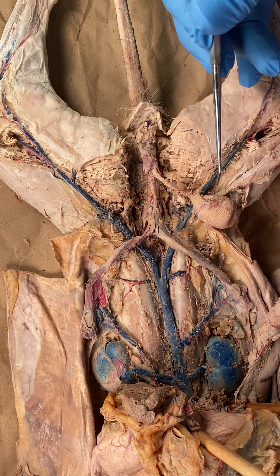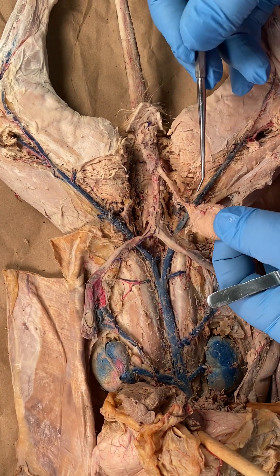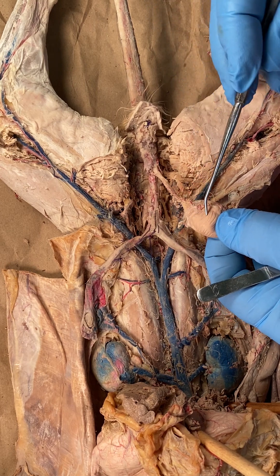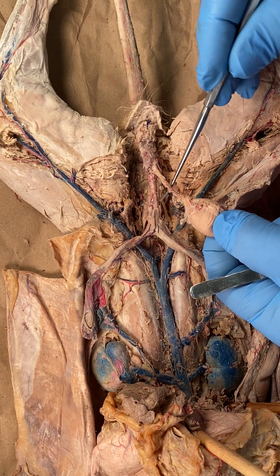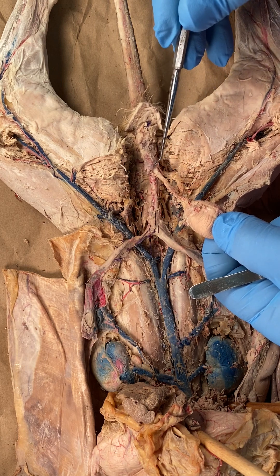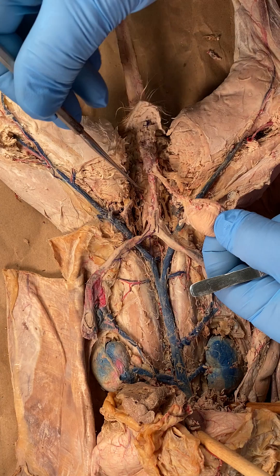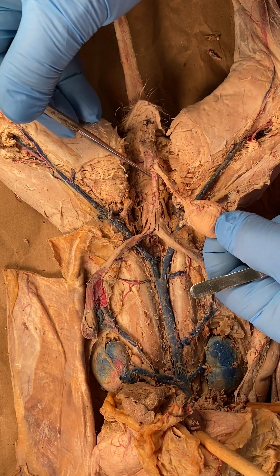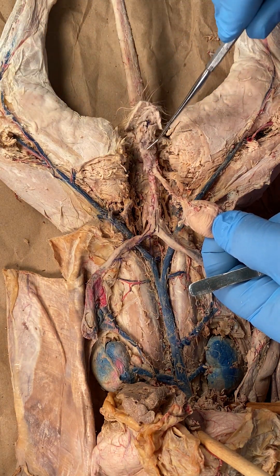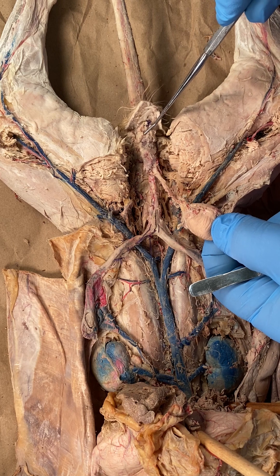The next structure you want to be able to identify is the urinary bladder. The urinary bladder has coming off of it the urethra. In the female cat, the urethra joins the vagina. After the urethra joins, this section right here is defined as the urogenital sinus.